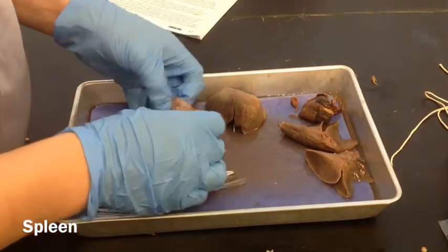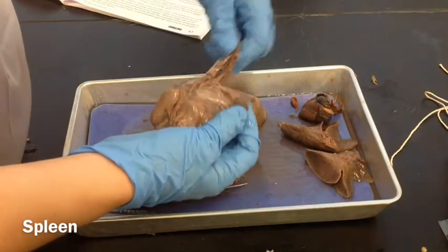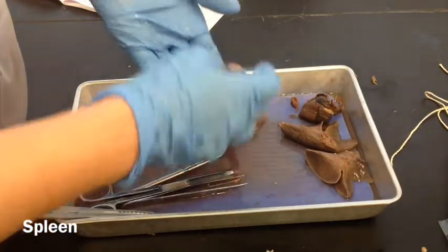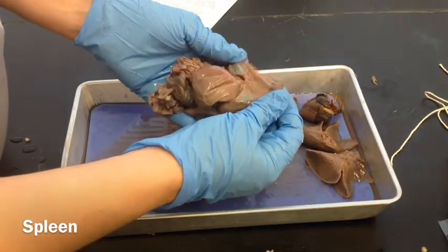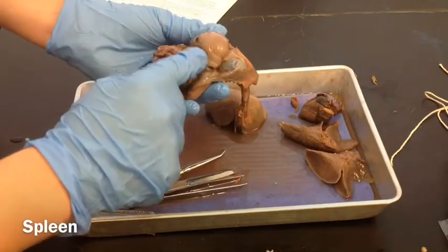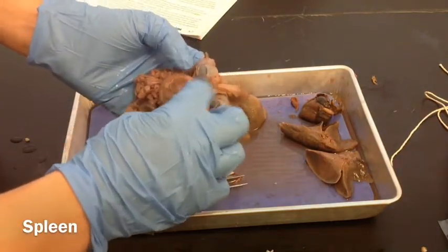You're going to see the stomach now. This is the back, and these are the kidneys. Flip it over so you can see the small intestines. So now with the liver gone, this is the diaphragm — the muscle that helps you breathe — and this is the stomach. Now we see the stomach and the spleen. The spleen is this kind of skinny long thing right there, and the stomach is that sack like that right there.